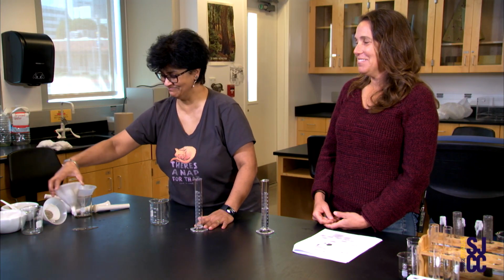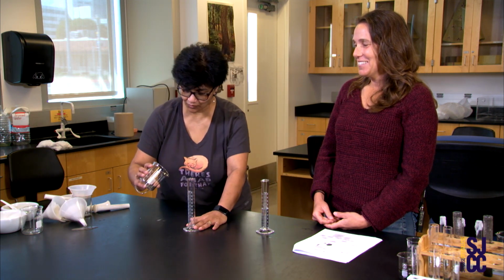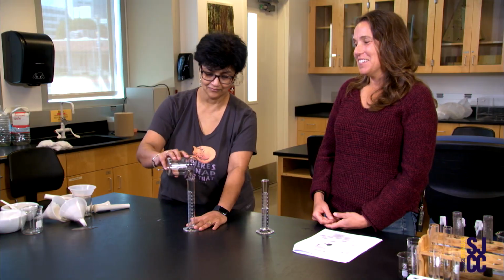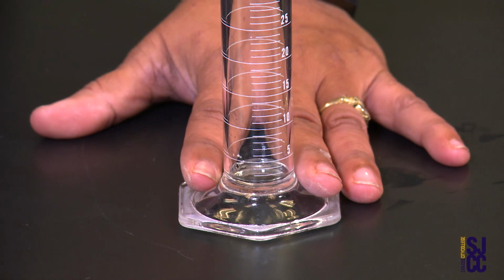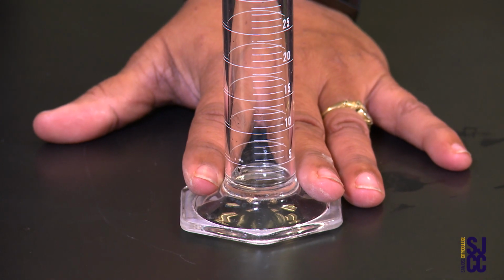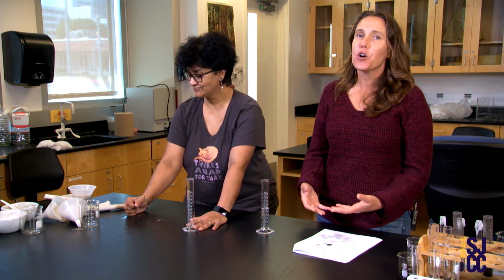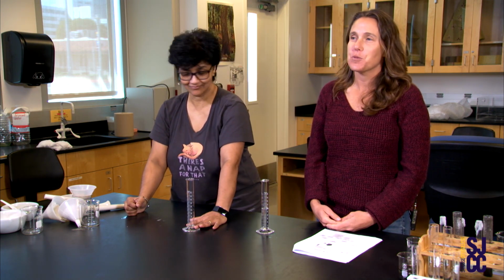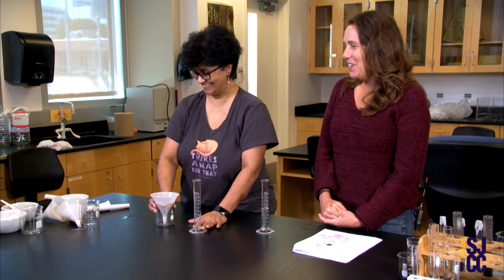You're doing great. Most of the water's up there. Ooh, nothing. Okay, so we have nothing, right? So from that, all the water was retained in the clay. That means 30 milliliters of water was retained in the clay, and we had no water leaching out, right? So we did a good job really grinding that clay with the mortar and pestle, right?